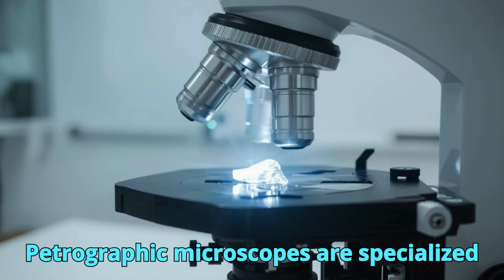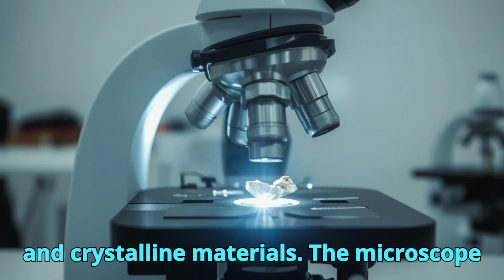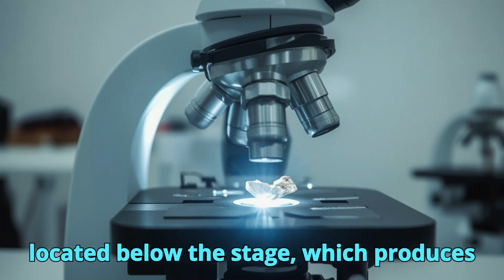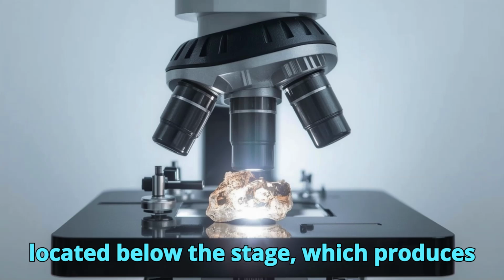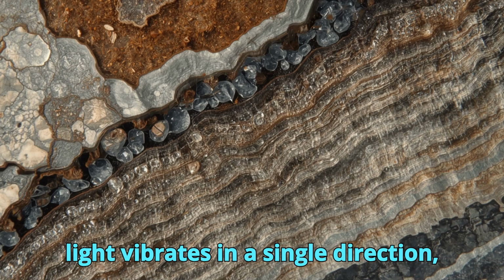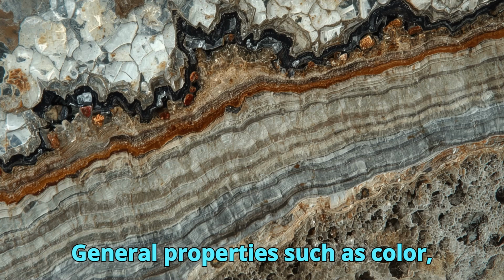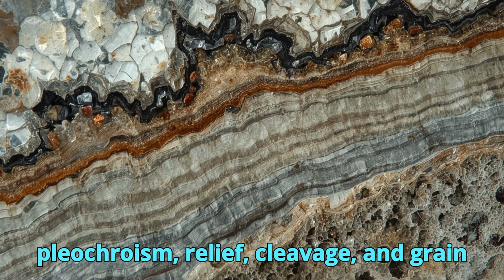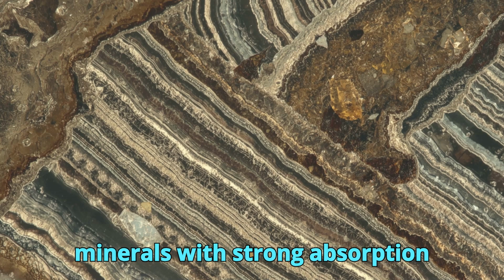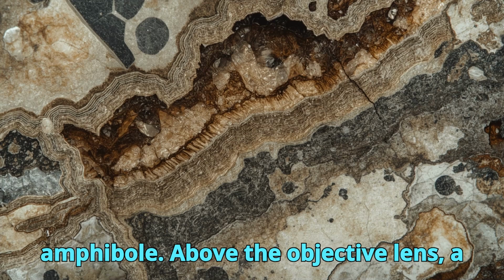Petrographic microscopes are specialized optical instruments designed to exploit the interaction between polarized light and crystalline materials. The microscope is equipped with a lower polarizer, located below the stage, which produces plane polarized light, PPL. In this mode, light vibrates in a single direction, allowing the observation of fundamental mineral properties such as color, pleochroism, relief, cleavage, and grain boundaries. Plane polarized light is particularly useful for distinguishing minerals with strong absorption characteristics, such as biotite or amphibole.